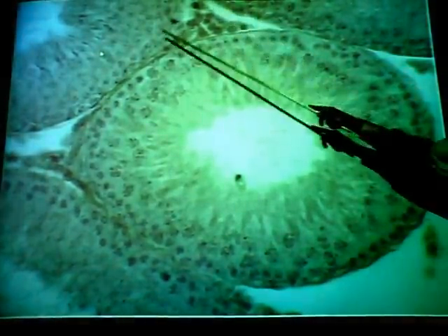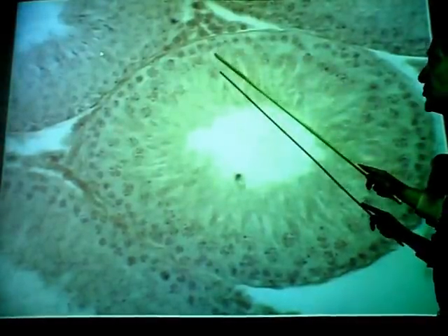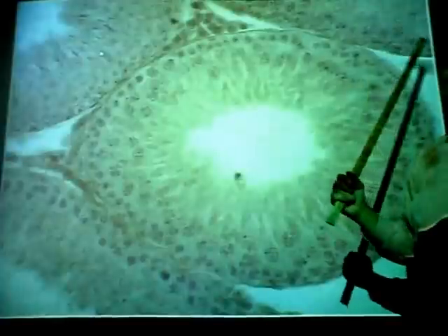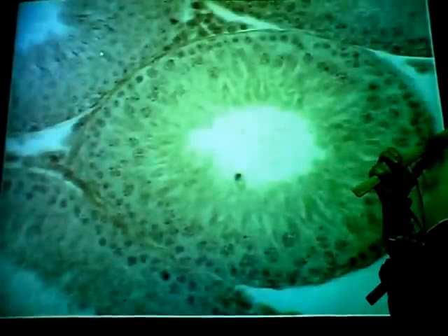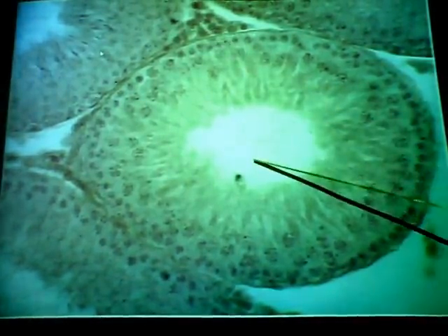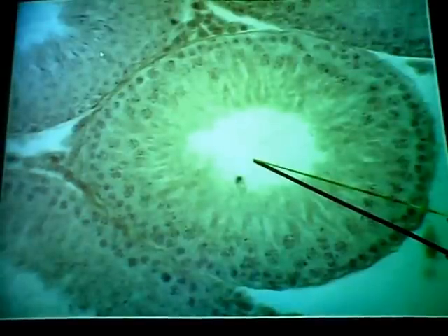Okay, there's another cell type that you need to be able to identify. These are pretty easy because they're found in spaces between adjacent seminiferous tubules. These are called interstitial cells or Leydig cells. What's their function? Produce sex hormones. Produce male sex hormones, the androgens, primarily testosterone. Okay? And of course, those hormones are released into the blood, not into the lumen of the seminiferous tubules. The sperm being here, we don't see any right here.